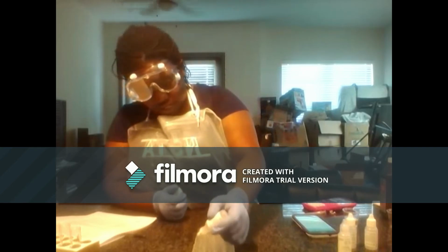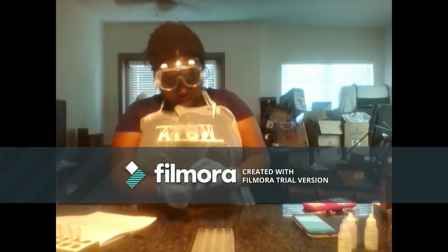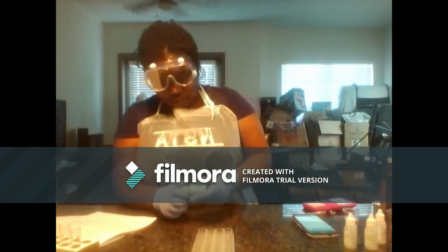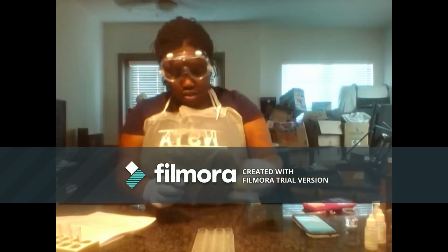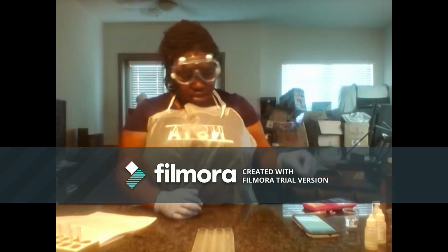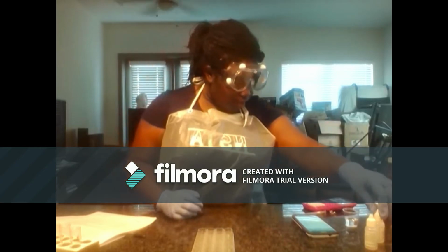So I will add to this well plate 8 drops of potassium iodide, 2 drops of hydrochloric acid, 4 drops of starch solution, no water, and I'll put 8 drops of sodium thiosulfate.